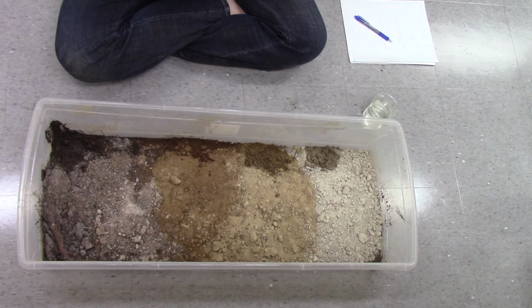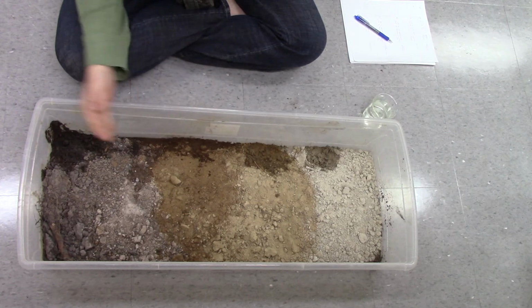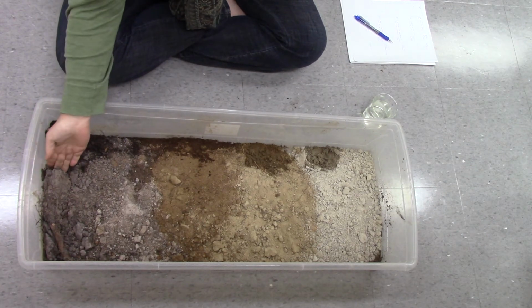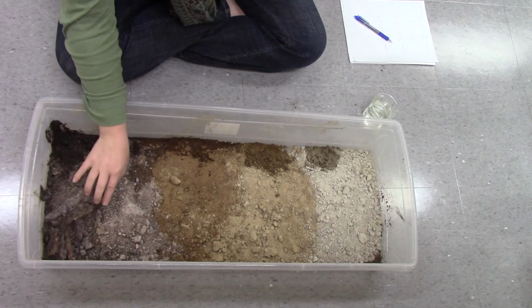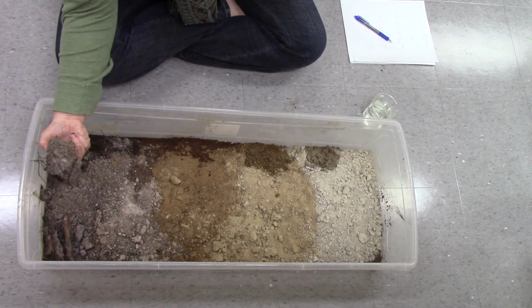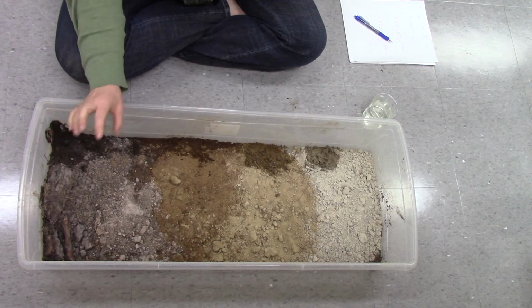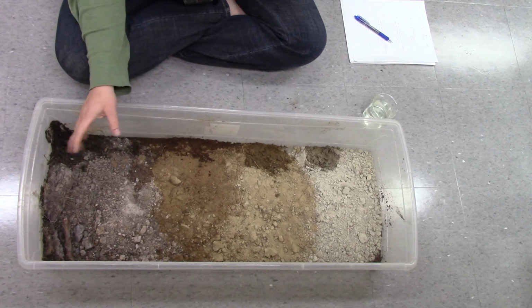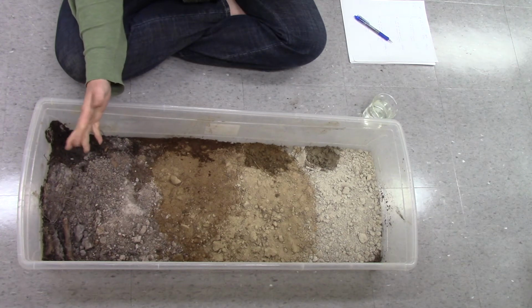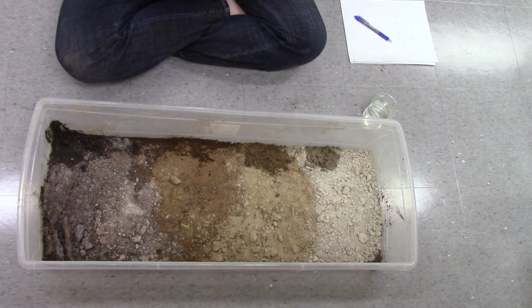While we're talking about roots, we should probably talk about pores. This is a very sandy, granular sample, so seeing pores is difficult, but in some columnar or certain samples, you can see pores within your peds, and you can look to see if those holes, those pores, have any kind of orientation or distribution. I don't have any to show you, so I'm just going to keep moving on.